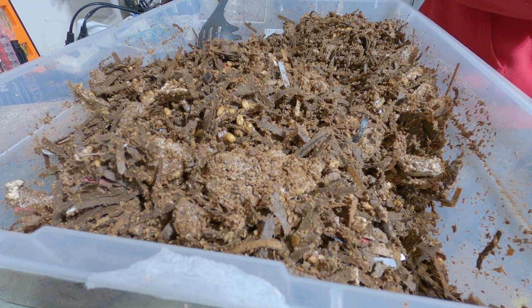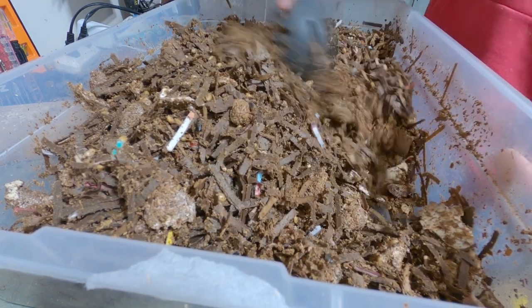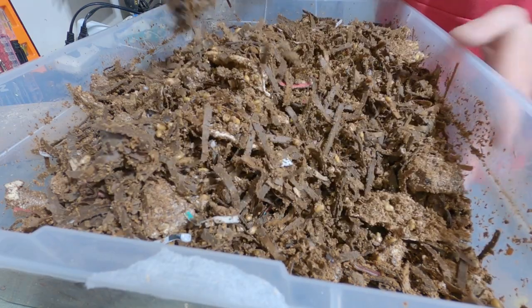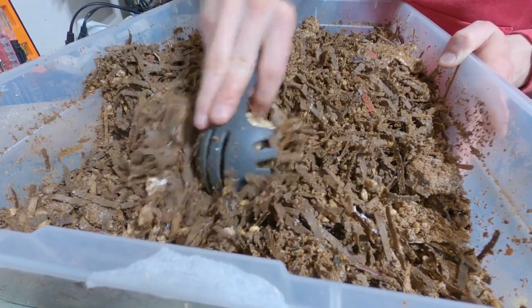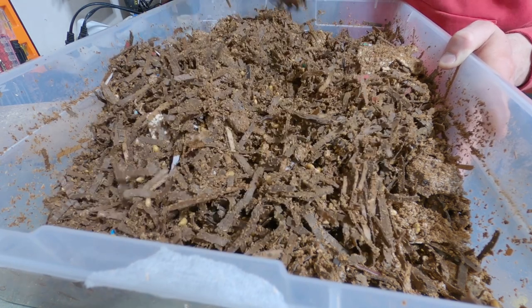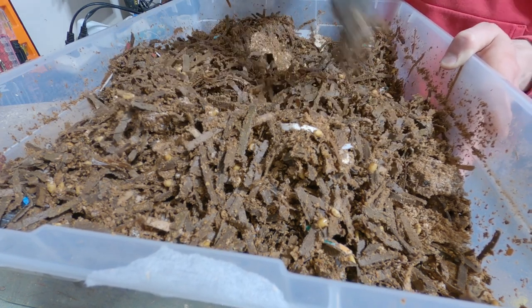Sometimes you've got to take a break, re-alcohol your hands, wear clean clothes — normal mycology stuff. You don't have to make your own sawdust spawn for this; you can buy it. A few companies sell it. This is turkey tail. I've heard Reishi does well — haven't tested it. Oyster would probably do fine, also haven't tested it for materials.